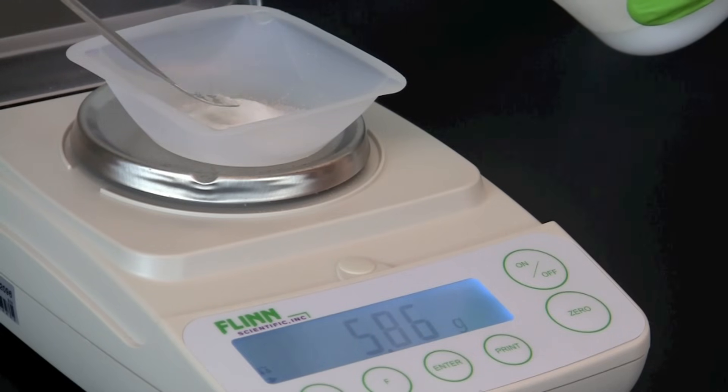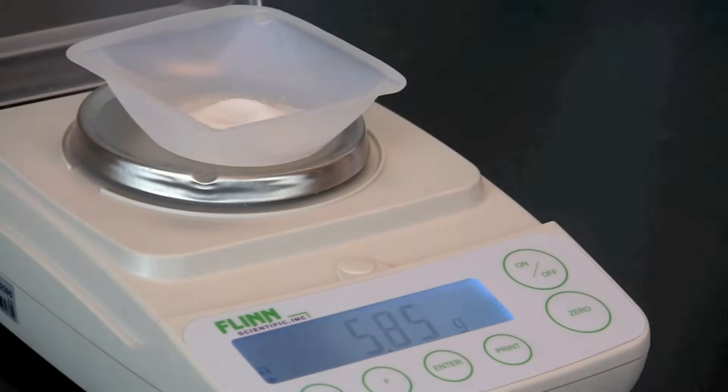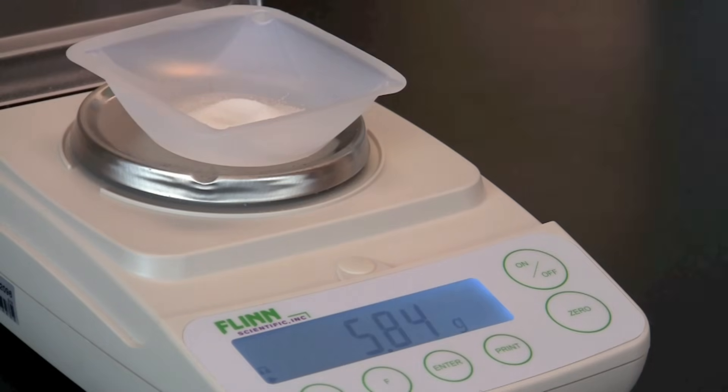Once material is removed from the stock bottle, any excess should not be returned into the bottle. This prevents contaminating the source.